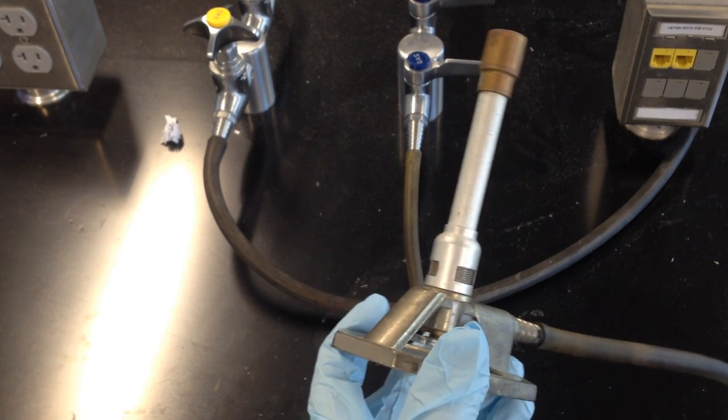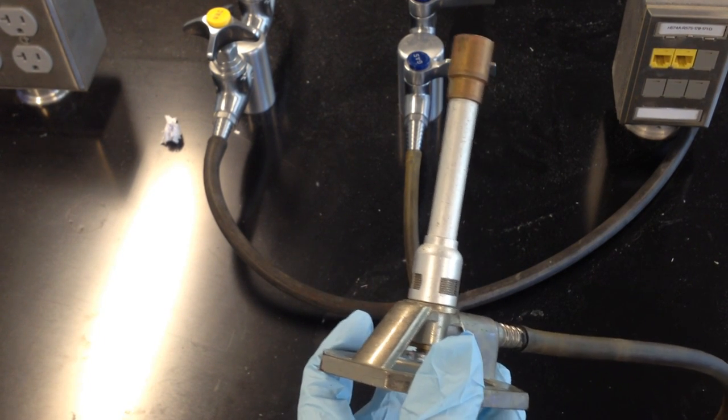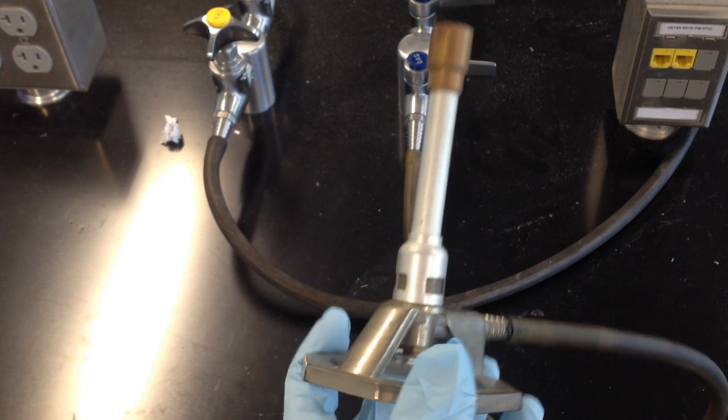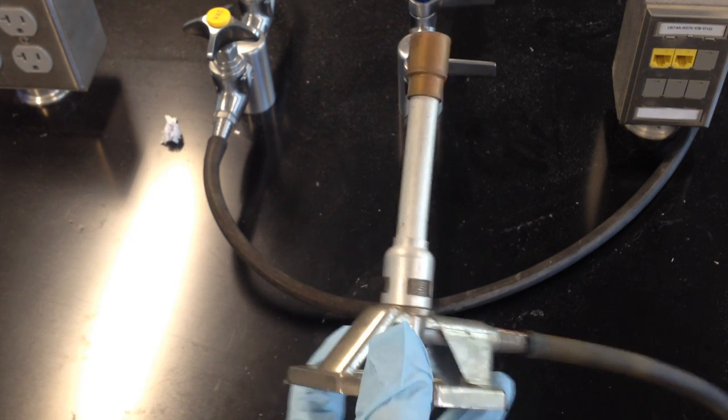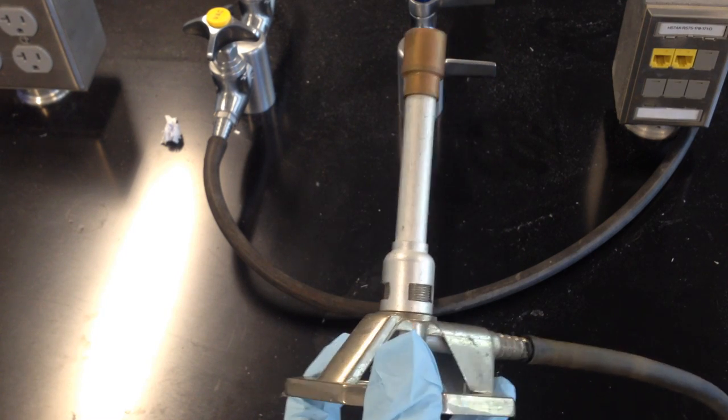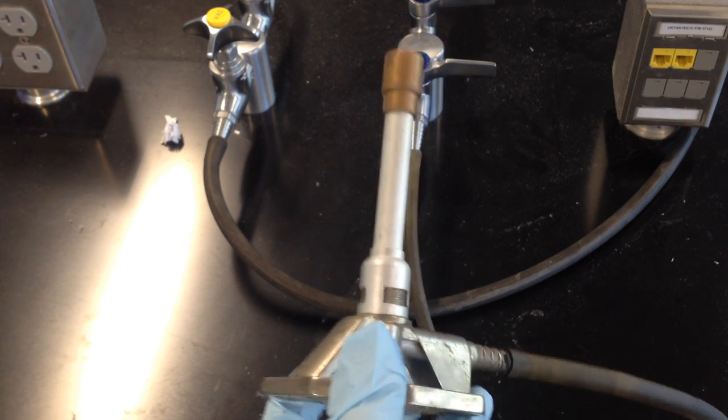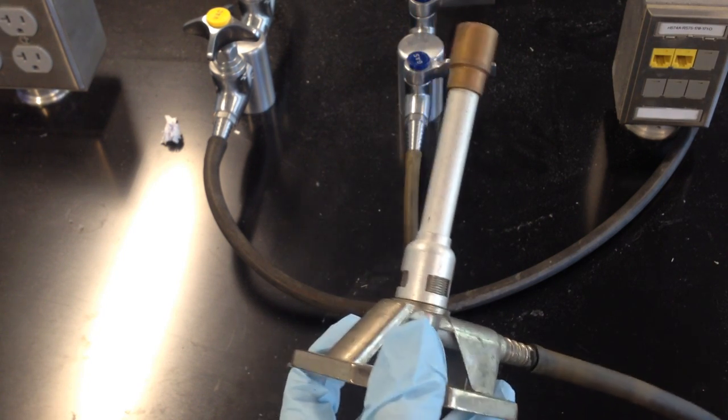When it comes to generating large amounts of heat, the chemist's instrument of choice is the Bunsen burner, and that's the device that you see right here. Lighting a Bunsen burner can be a little bit tricky when you're first starting out, so the purpose of this video is to show you a good technique that works pretty much every time for lighting your Bunsen burner.